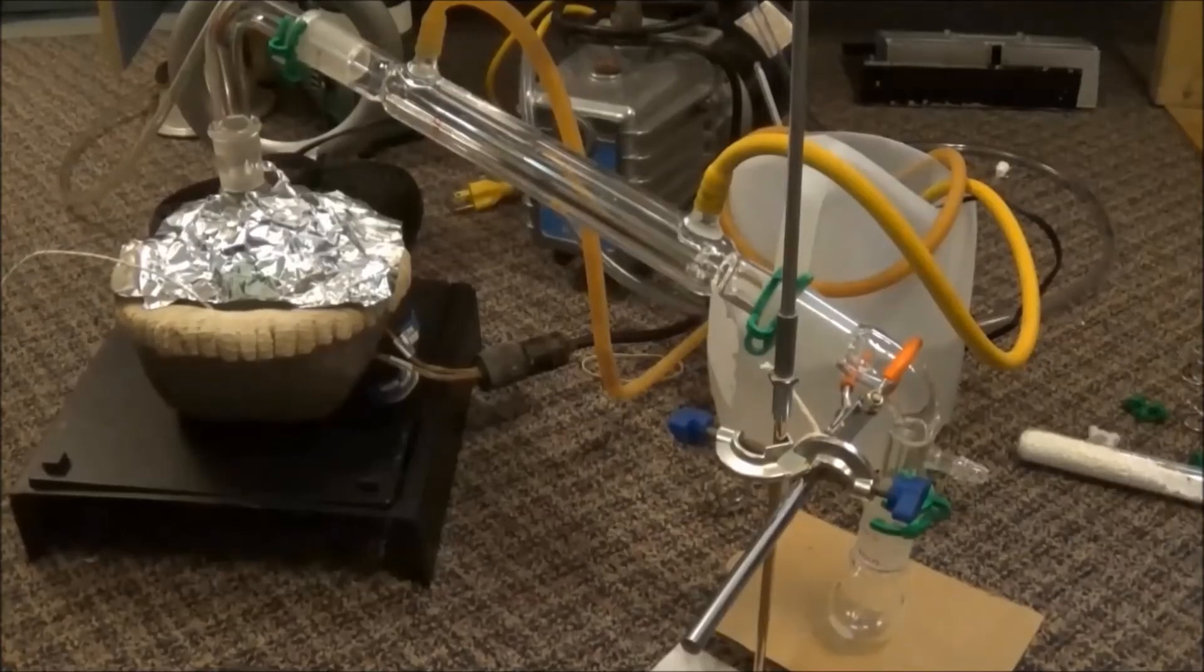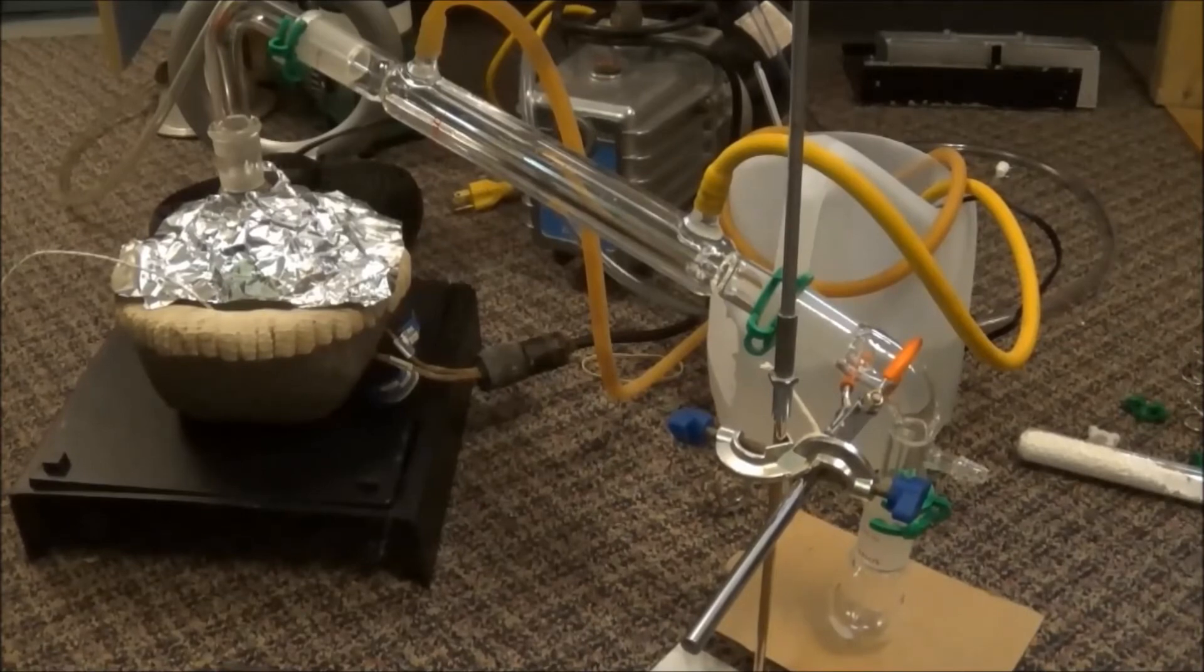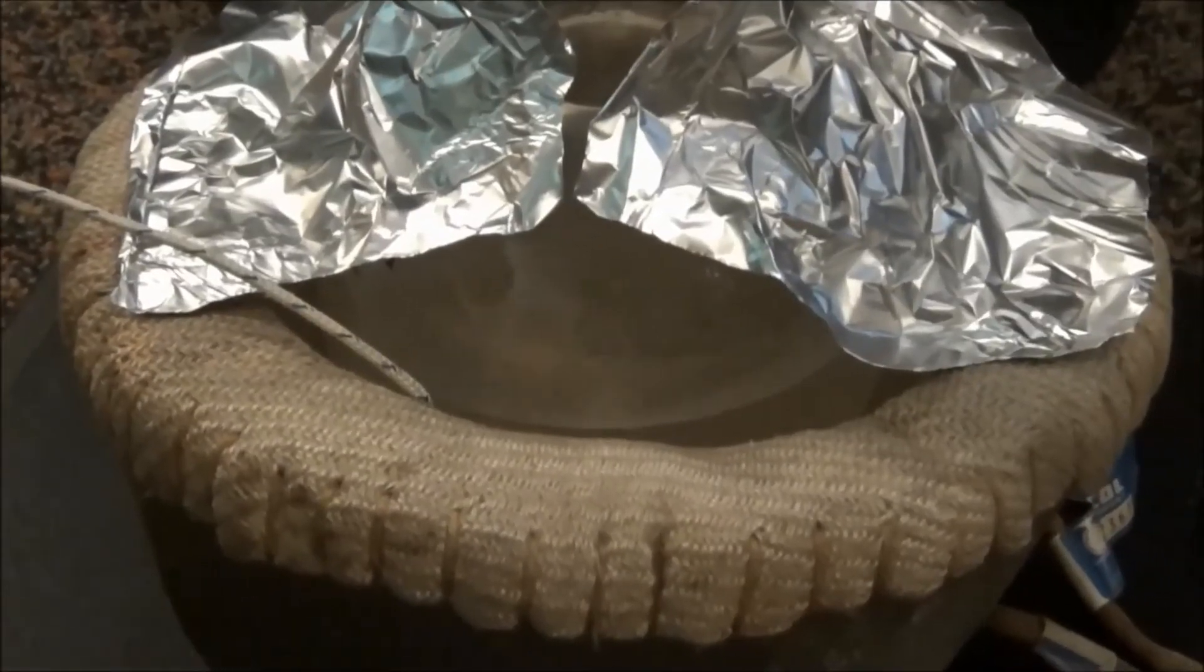I got impatient and went straight to distillation. The water can then be removed as a low boiling azeotrope, leaving relatively dry toluene to be distilled over.